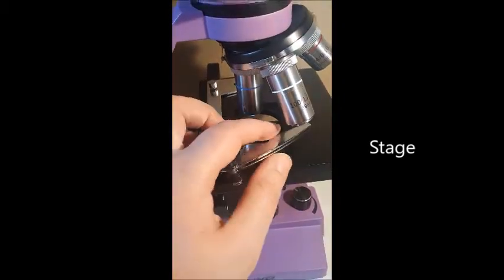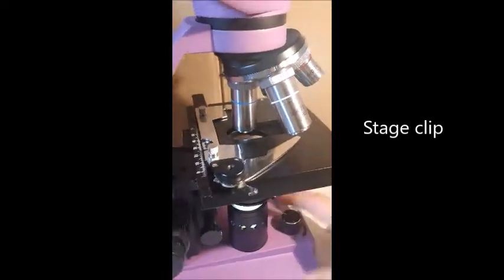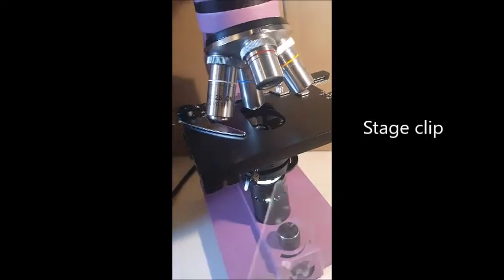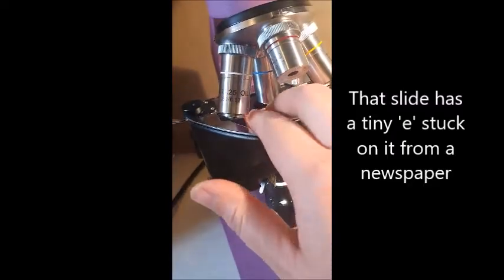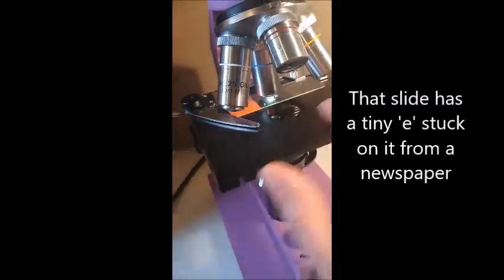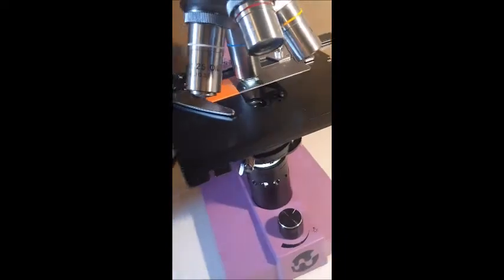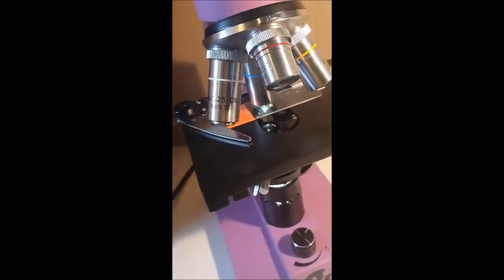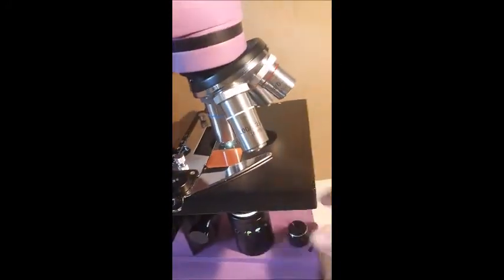This here is called a stage clip, and it basically just holds the microscope slide in place. So if I've got a microscope slide here, you put it in there and see it sits up in this corner, and then this clip just holds it in place. So that's the stage clip.